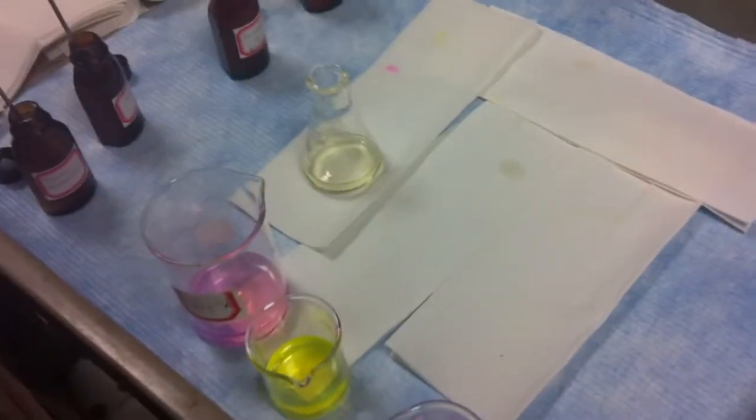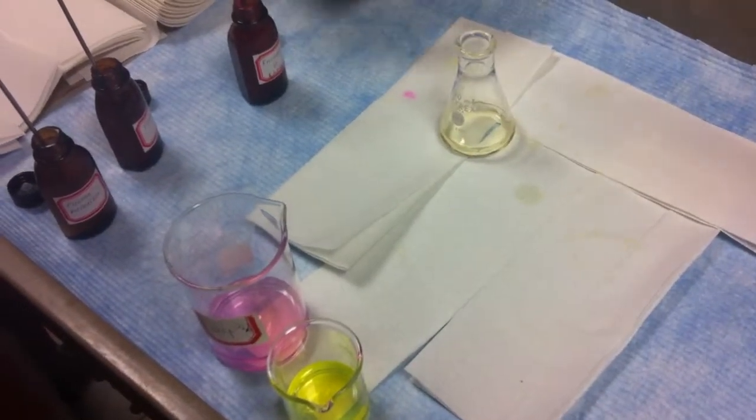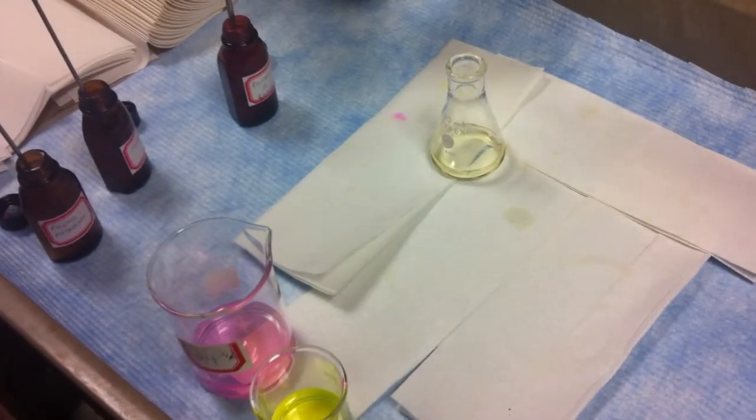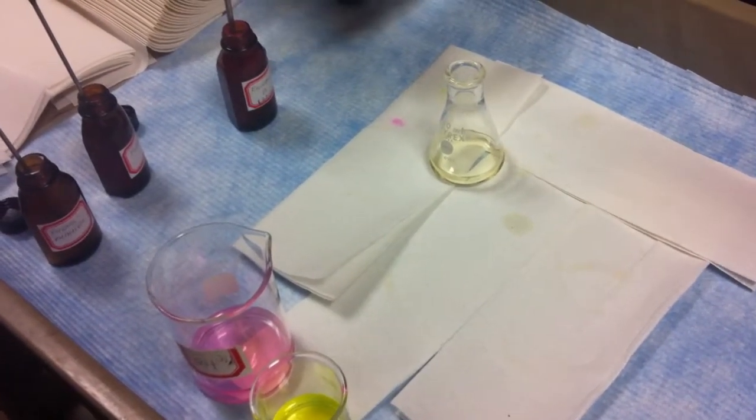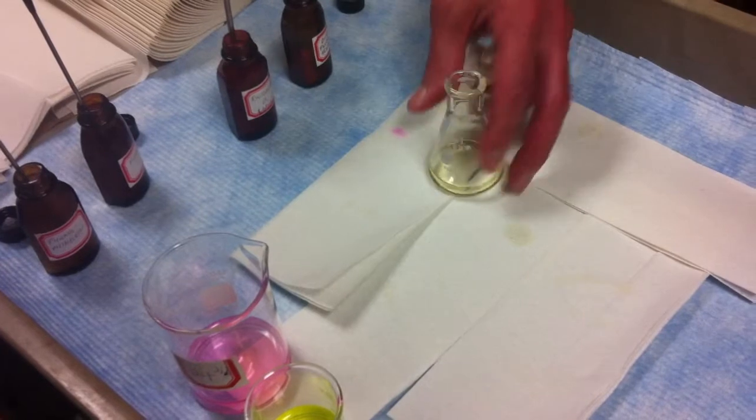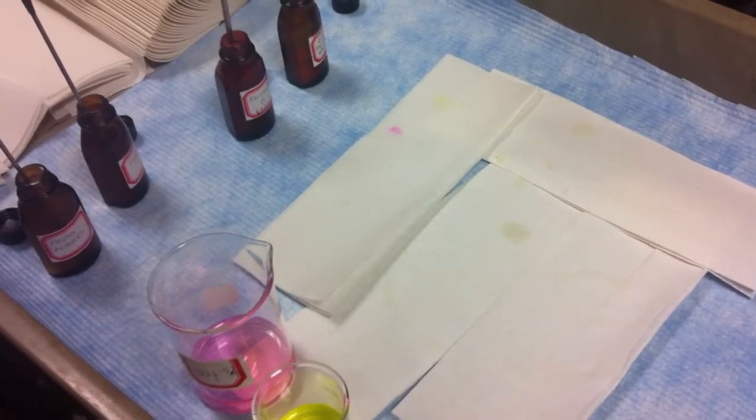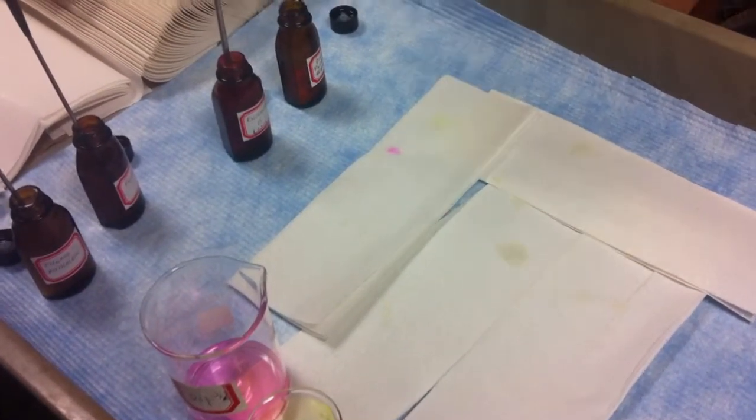Okay. Now, last one. Yay! And this one is like chlorofluorescein. Dichlorofluorescein. Dichlorofluorescein. This is like a pea colored one. Small.